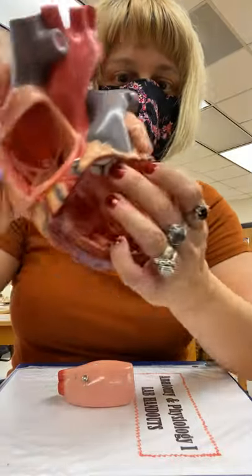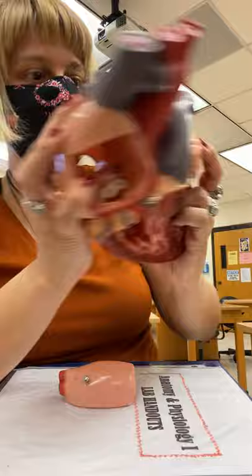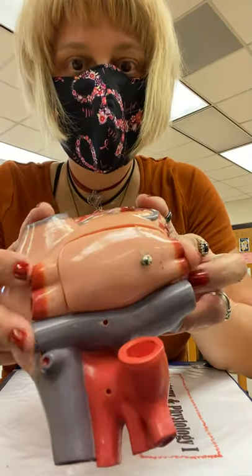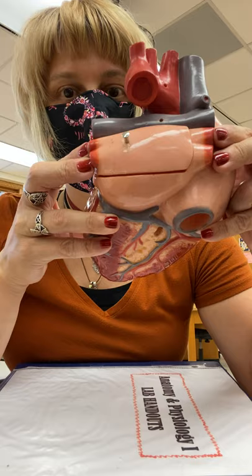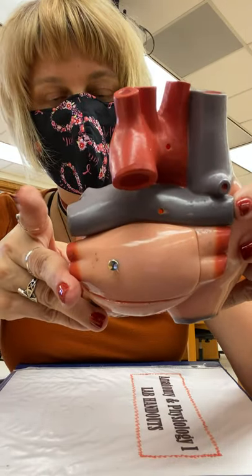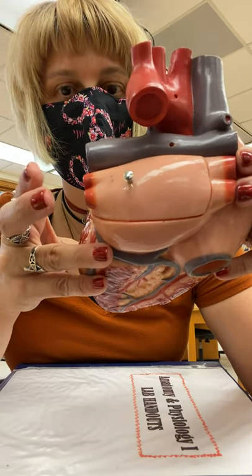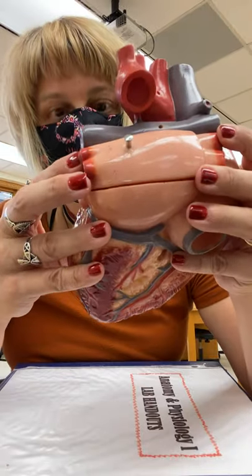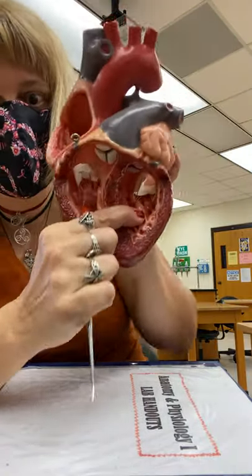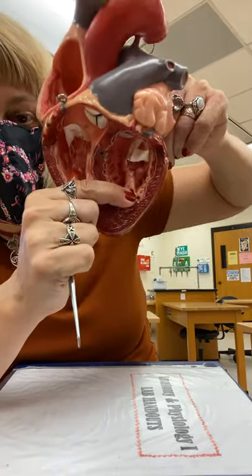In the left atrium, you've got two pulmonary veins from the right and two from the left feeding in. Do you see how posterior the pulmonary veins are — they're posterior and inferior to the pulmonary arteries. In the pulmonary arteries, there's only one to the right and one to the left. But coming back from the lungs, you've got two pulmonary veins from the right and two from the left. All four enter the left atrium — left atrium into left ventricle.